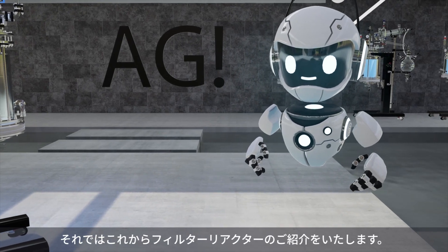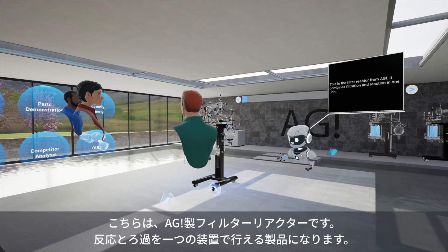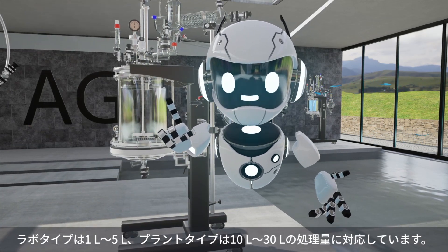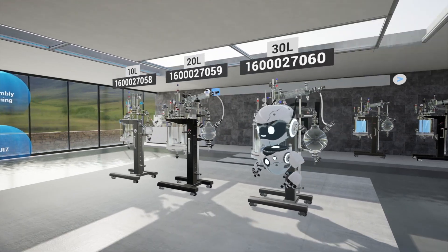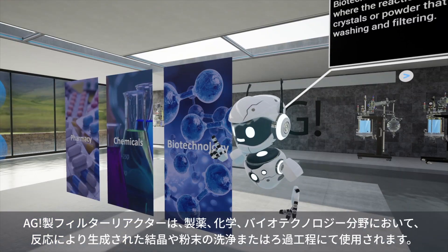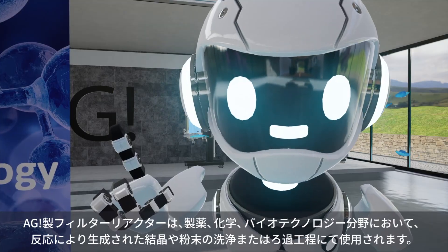Let's start with the filter reactor. This is the filter reactor from AGI. It combines filtration and reaction in one unit. We have benchtop models available from 1 liter to 5 liter and pilot plant models from 10 liter to 30 liter. AGI filter reactors can be used in different industries such as pharmaceutical, chemical and biotechnical industries for processes where the reaction end products are crystals or powder that require washing and filtering.